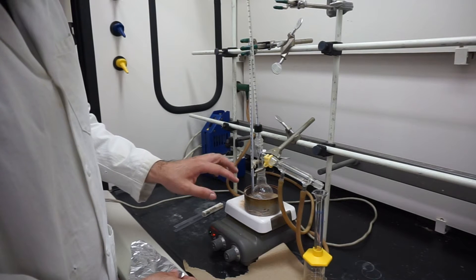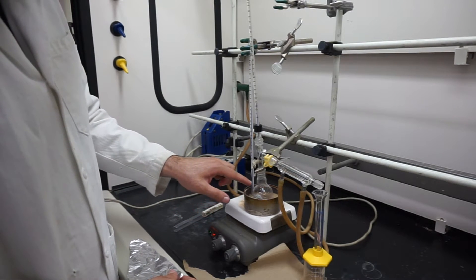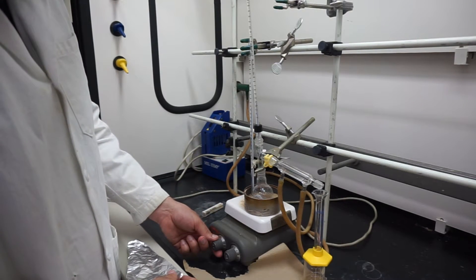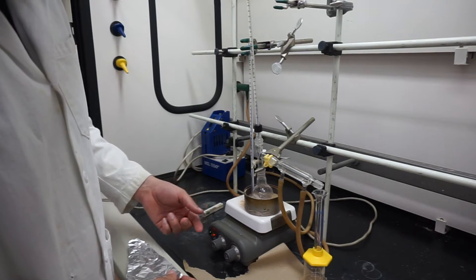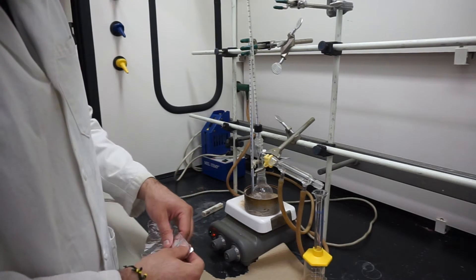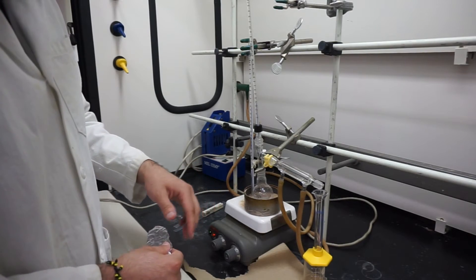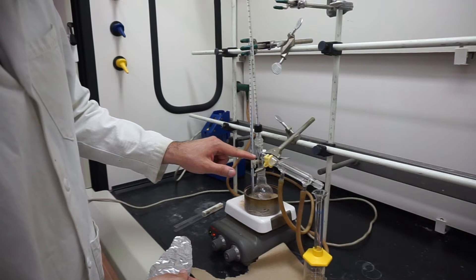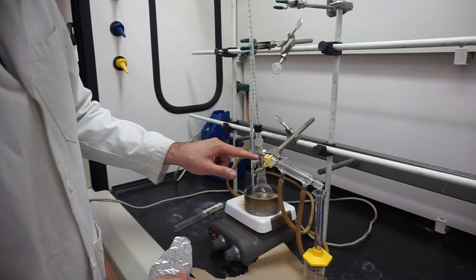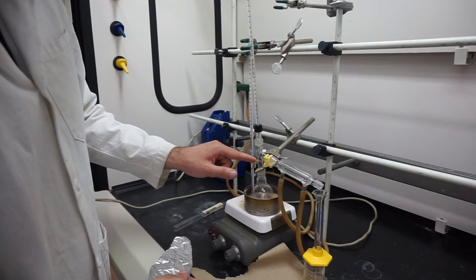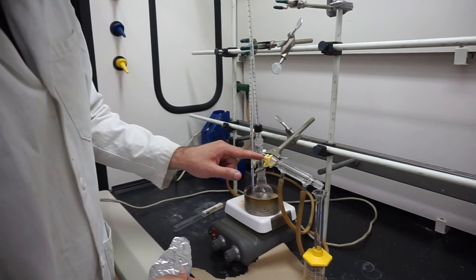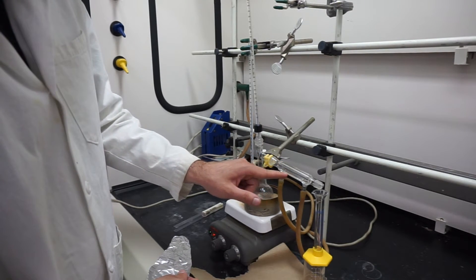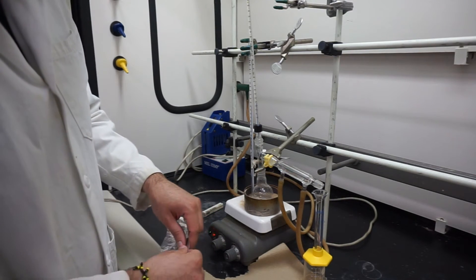Now that I've actually had this running for a little bit, you can see some condensation building on the outside of this round bottom flask. Make sure you turn on your stir bar—it'll help get the liquid flowing a little bit more, better heat transfer. We're going to take some aluminum and wrap up our piece all the way up until about right here. The reason we're going to do that is to essentially trap all the heat right here and allow the water to get to this point where it's going to cool down and recondense in our water-cooled condenser.